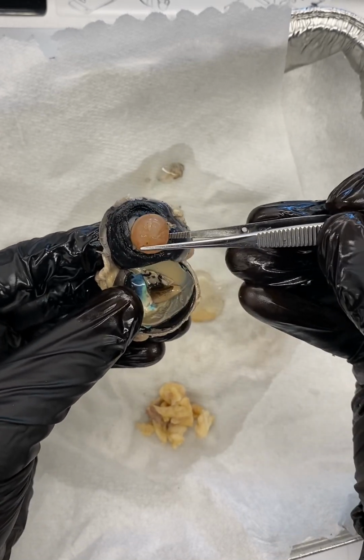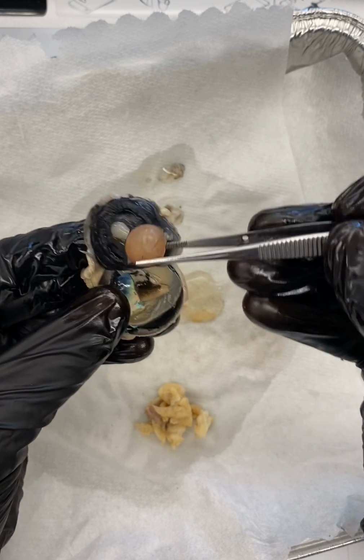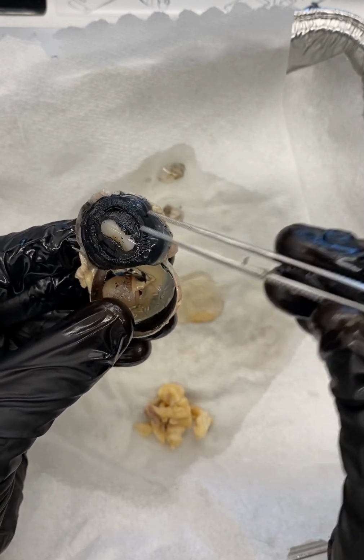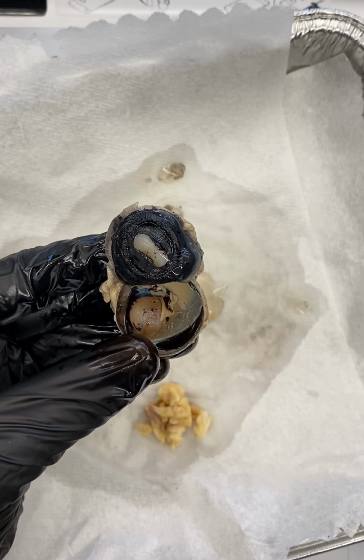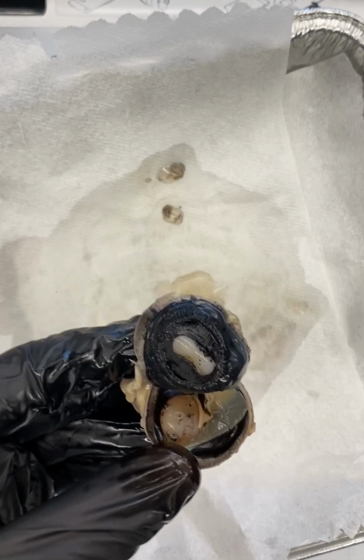So as your lens sits here and that ciliary muscle contracts and relaxes, it's changing the tautness, how tight the suspensory ligaments, the zonular fibers, are, which in turn is changing the shape of the lens, right? Now, why is this important? Why do you need to do this?